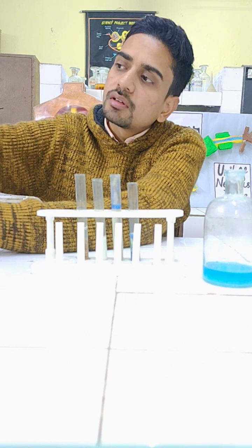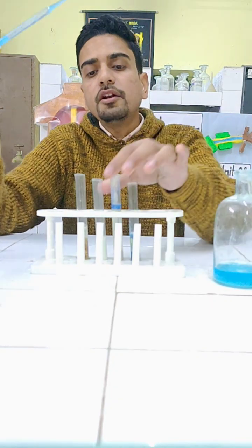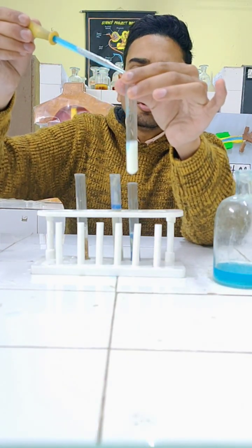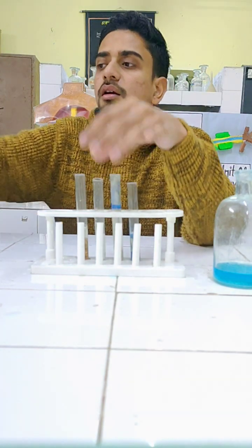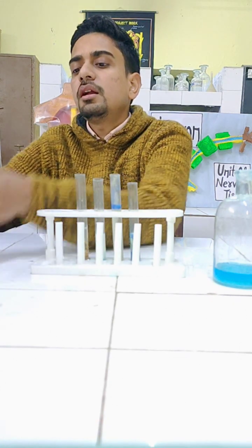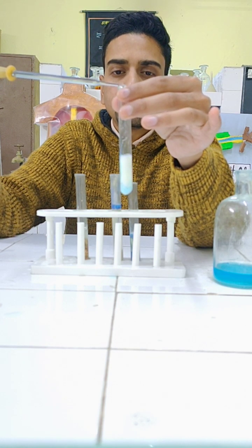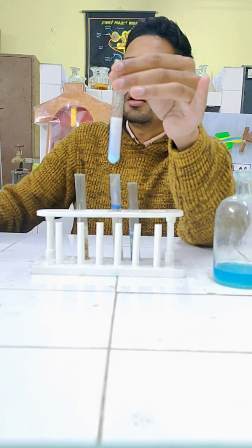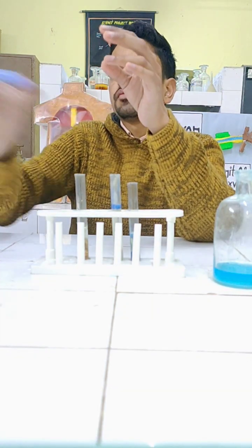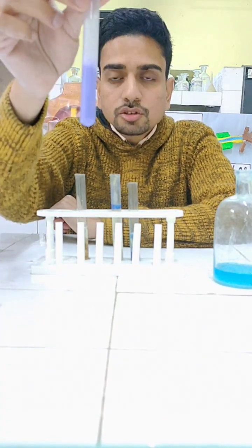Now let's check if protein is present in milk. Two drops of copper sulfate into milk, and ten drops of caustic soda into milk. Shake it — and we can see the color has changed to violet. Violet color indicates the presence of protein in milk.